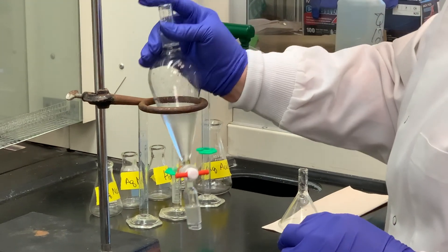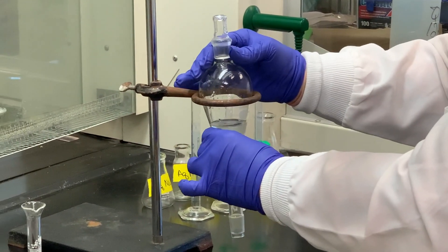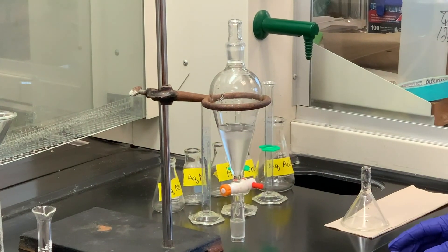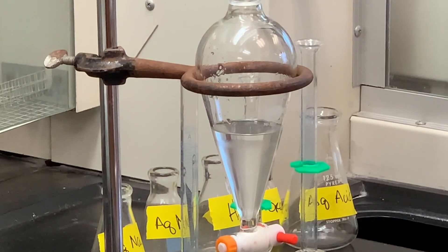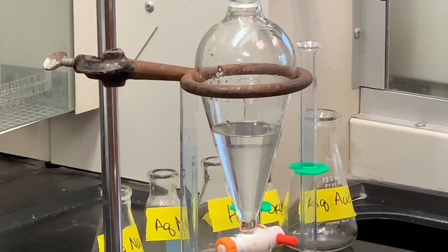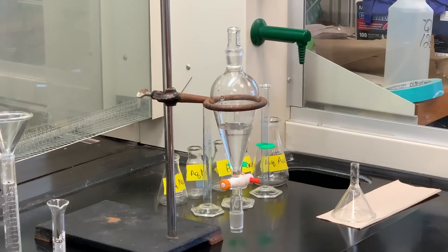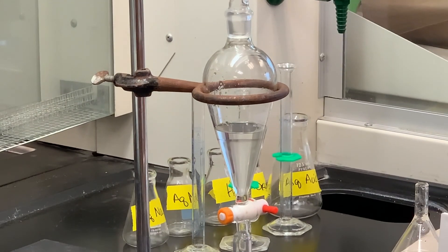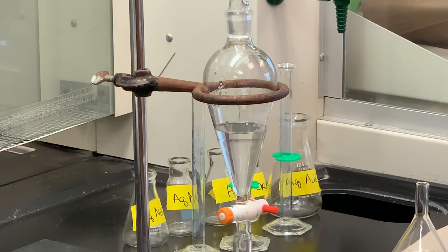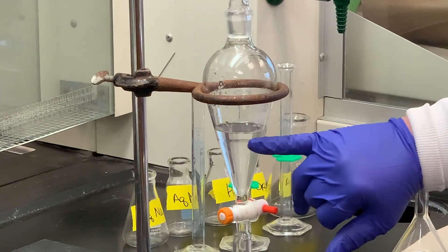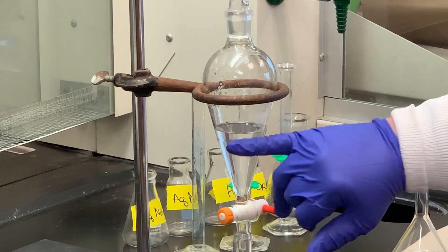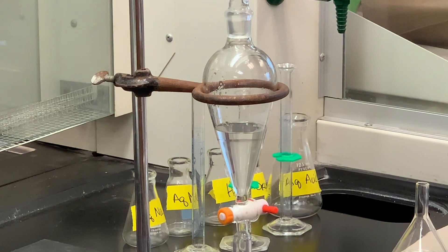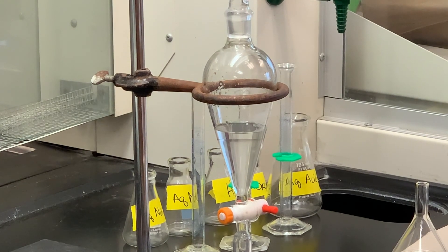And it has now been five minutes. So we're going to let this sit until we see two layers separate. And I think you can see where the layers have separated. Now, what we have done, the reaction should be complete at this time.